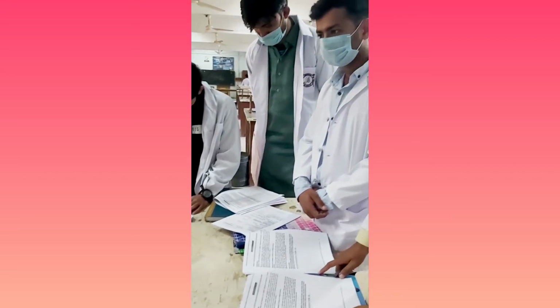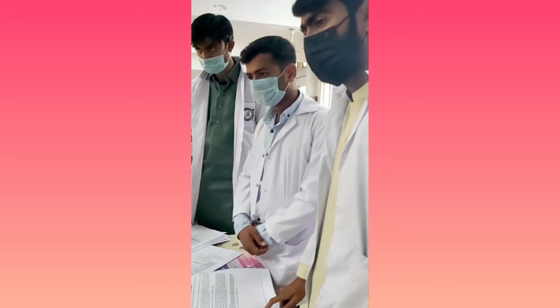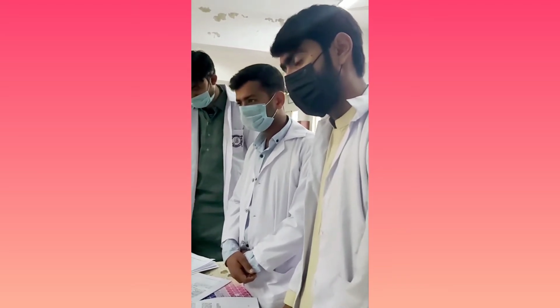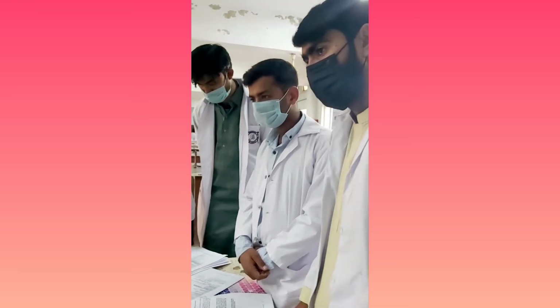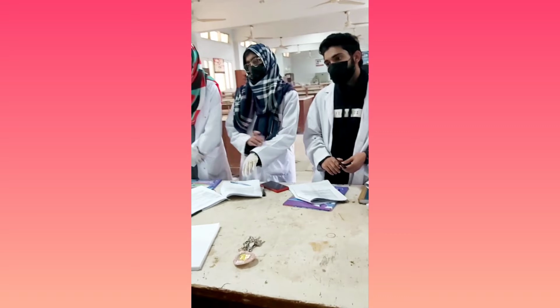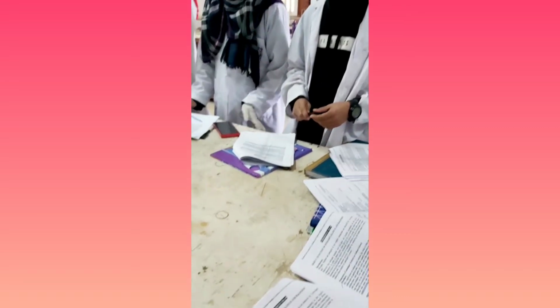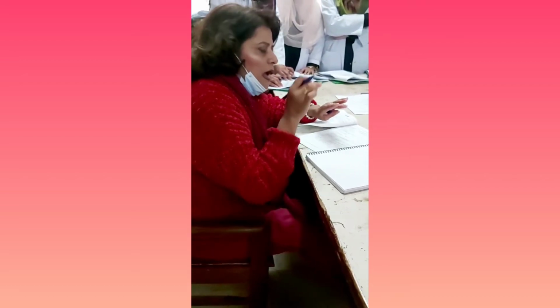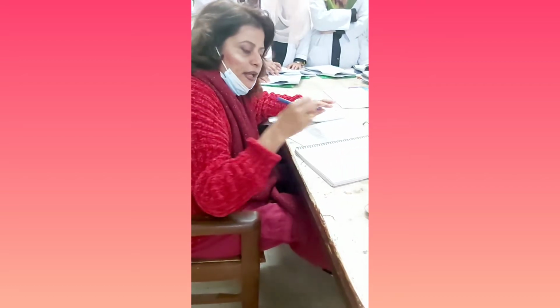So if you are holding a sodium metal in your hand, it can catch fire, right? So be careful when you are dealing with the sodium metal. Do not touch it. You'll have a severe burn if you just touch it. Mr. Irfan is here. He's our lab assistant. He's gonna cut down the bigger piece of sodium metal into a smaller one, which can be introduced into the ignition tube. Now let's read the procedure.